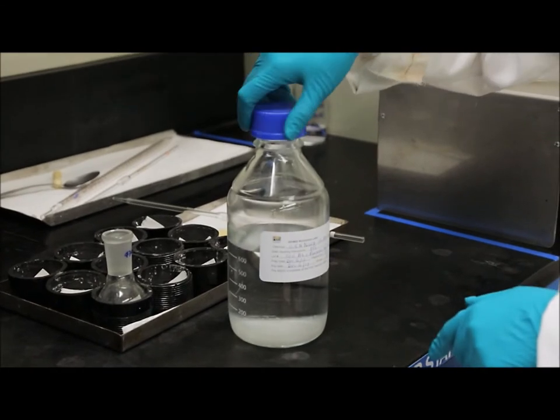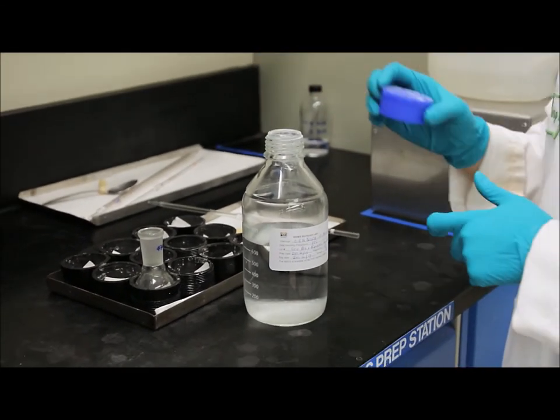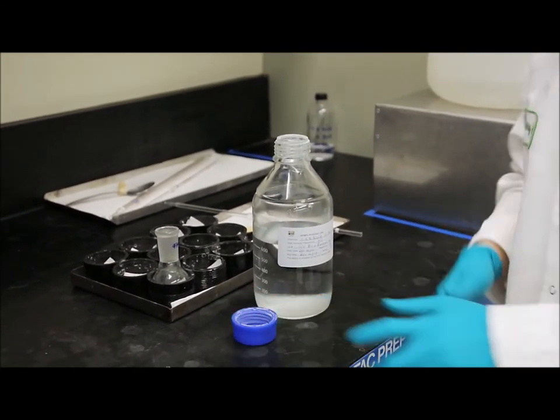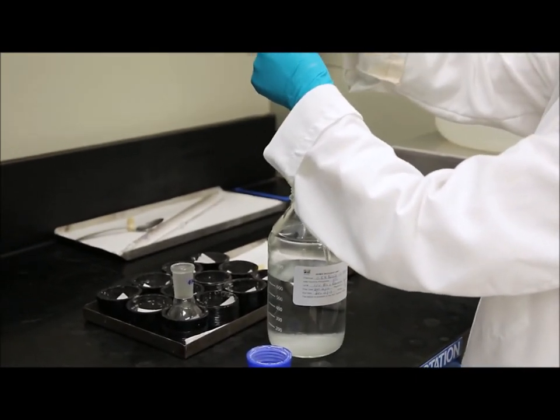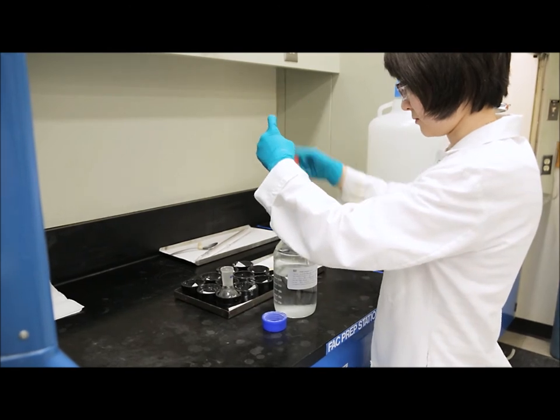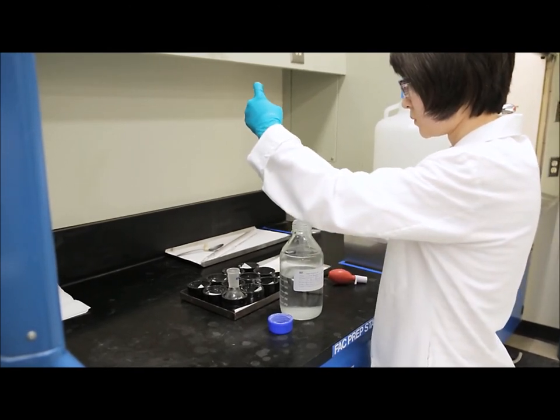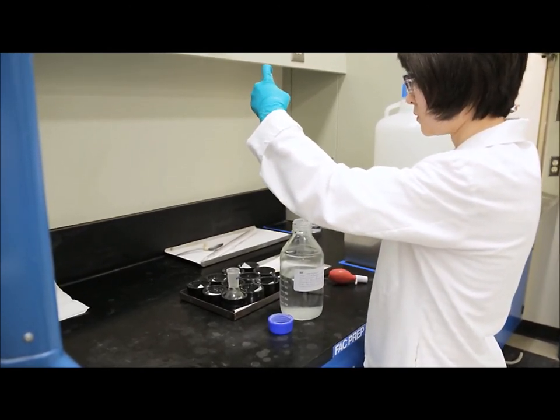The next step is pipetting. We are adding in our 0.5 normal sodium hydroxide and methanol solution into the flask. Our 0.5 normal sodium hydroxide and methanol is going to act as our base catalyst in the reaction.